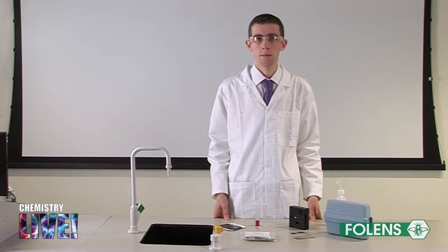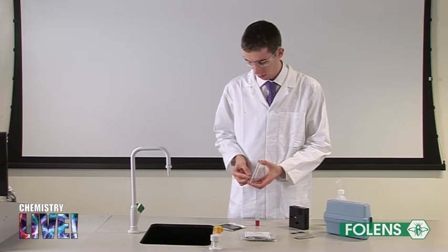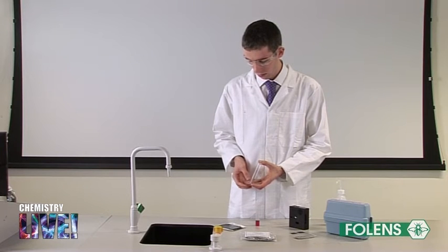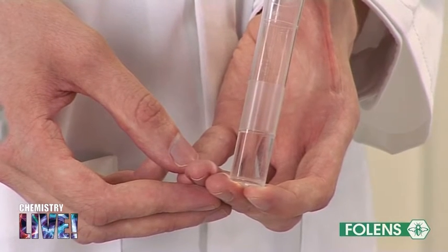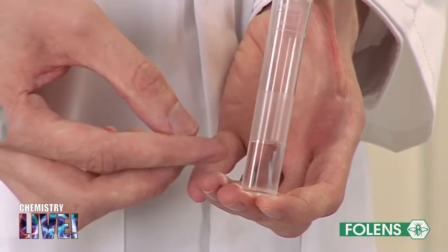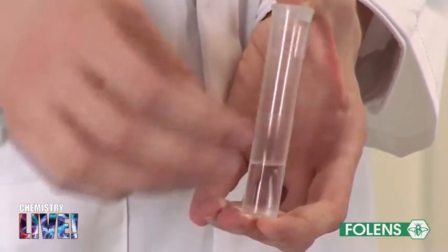5 cm³ of deionised water has been placed in one of the colour viewing tubes, which are similar to small test tubes. The level of the water will now just be below the frosted part of the glass in the tube. The stopper has been placed on the tube.